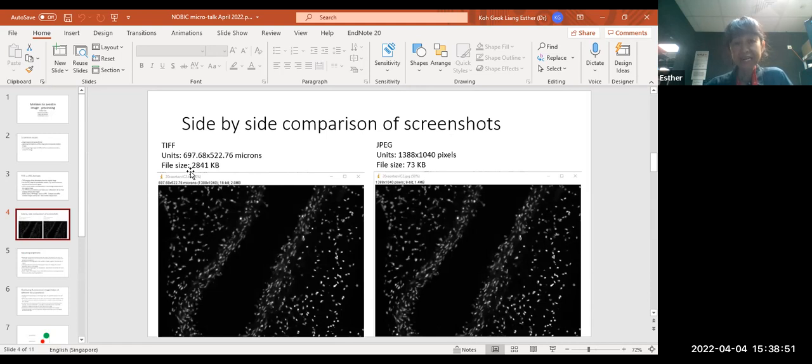2,841 KB. But one thing which I mentioned before regarding the units of measurement: in a TIFF image, you have the units in microns, whereas in the JPEG image, you only have pixels. So you don't have the information of the size of the things in the image. Okay, so what I'm going to do now is to launch my ImageJ. Actually, I've already got it. Can you guys see my ImageJ menu?